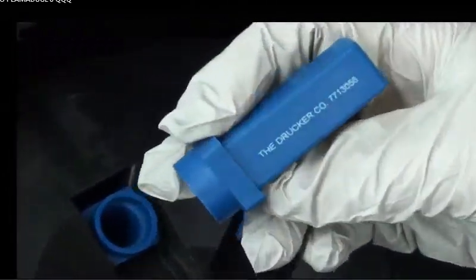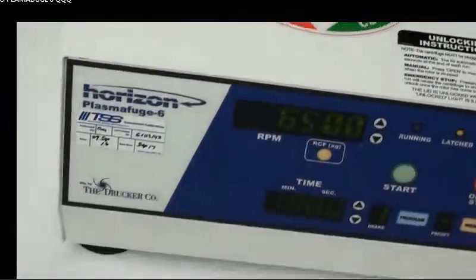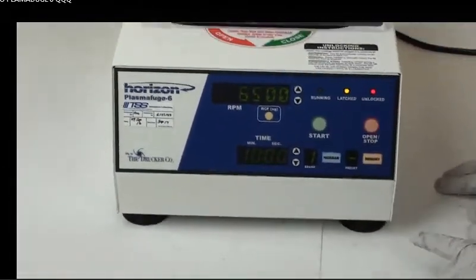Here are the cylinders right here. I'm going to put it back into place. I'm going to shut the lid down and I'll have Eric step back a little bit so I can show you how you can program this.